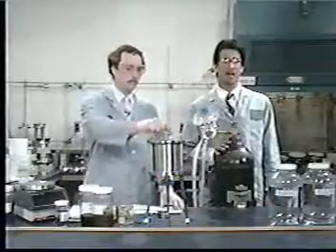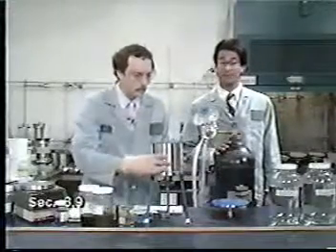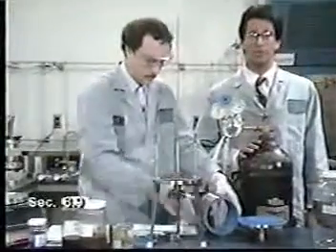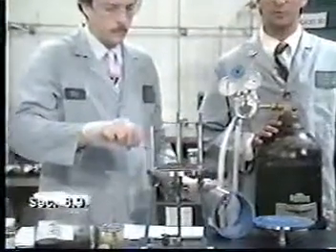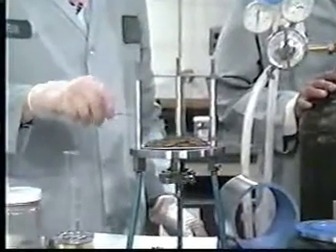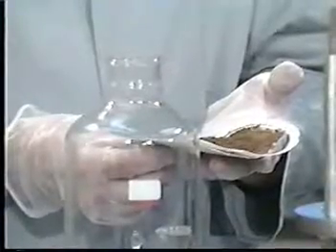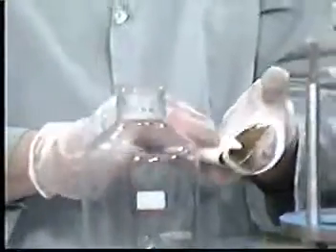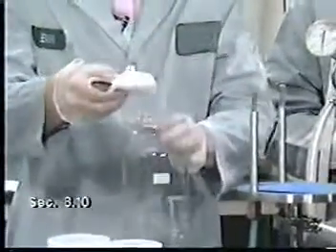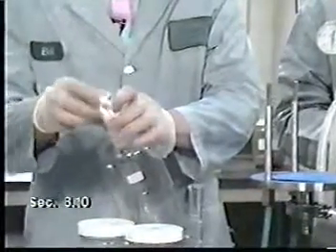Disassemble the filtration apparatus and remove whatever material is inside, along with the filter. That material is defined as the solid portion of the waste, and it will undergo TCLP extraction. If particle size reduction is necessary, it may be done at this time. When the particle size is sufficiently small, place the solid and the glass fiber filter in a borosilicate bottle. Borosilicate glass is recommended because other types of glass can cause contamination problems, especially for metals.